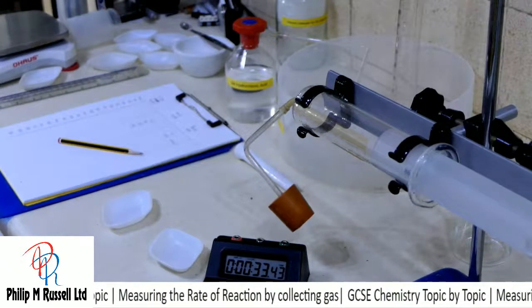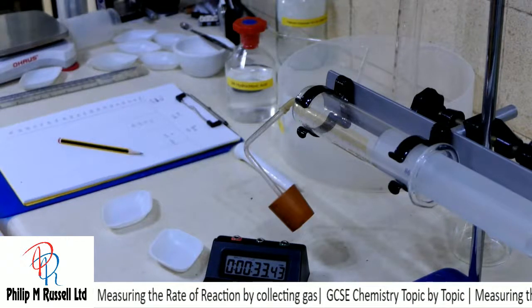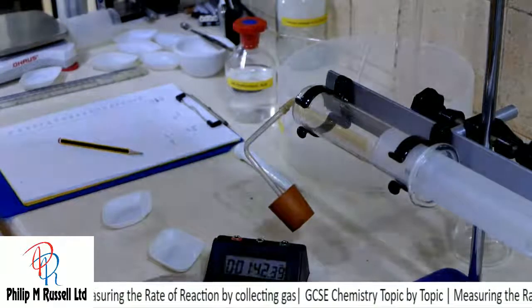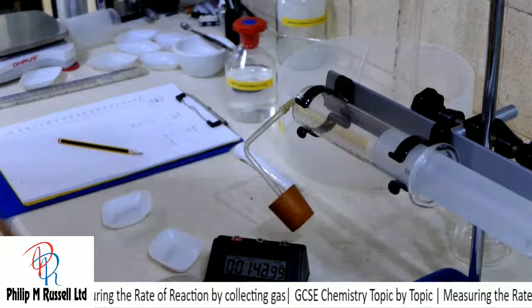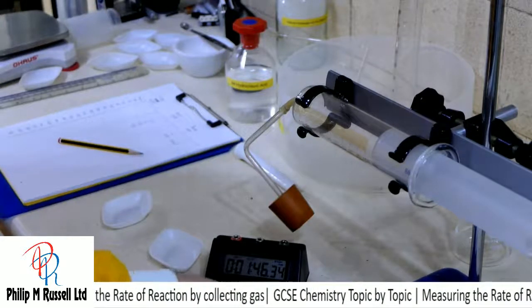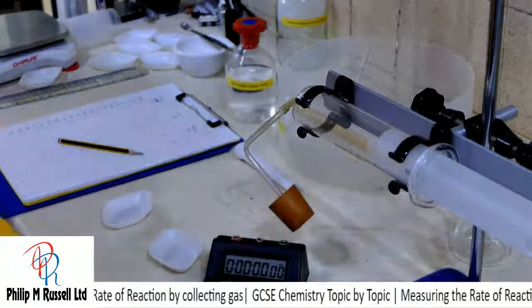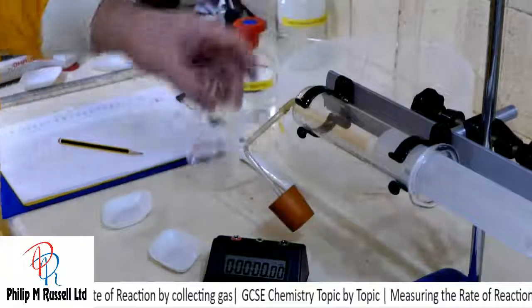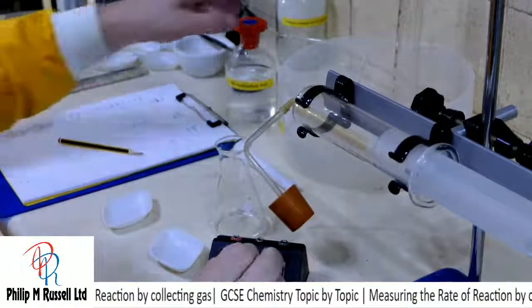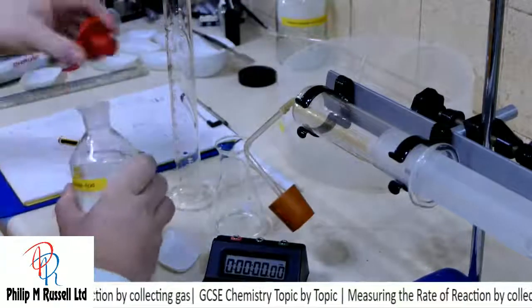Right, so now we're going to do the third of the experiments. So let's reset. Right, stop, reset, good. And we're ready to have a go. I want 30 centimetre cubed of acid.